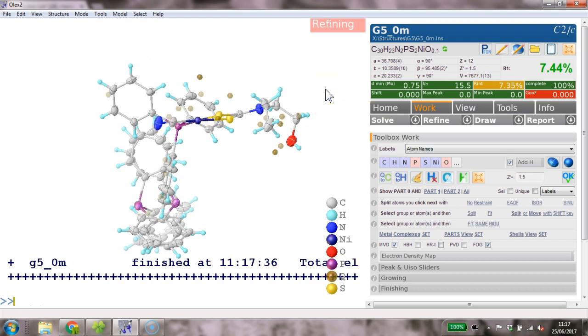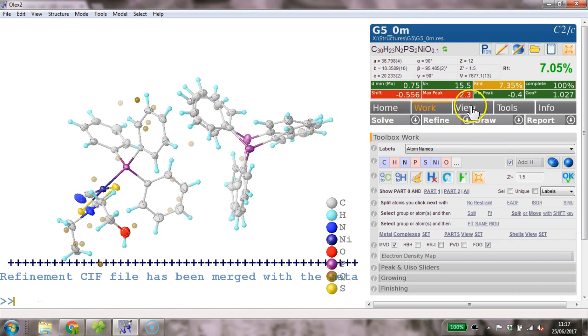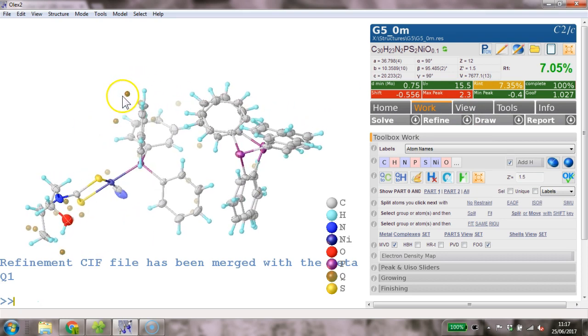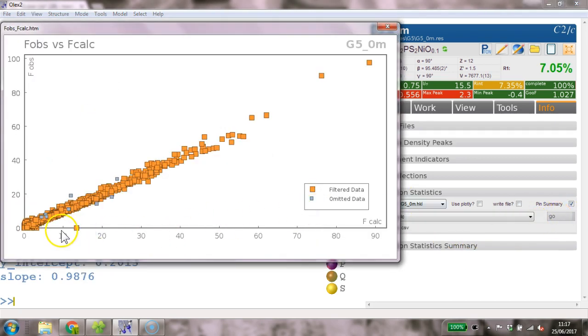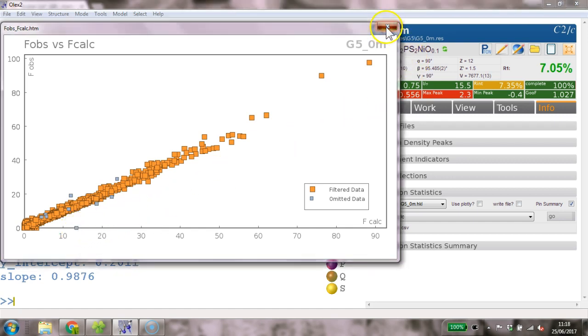Now let's find whether we have some sort of disorder or something going on here. Well, first of all, the biggest peak, 2.3, is actually at that phenyl group here. So that's very strange. That doesn't make much sense. So the first thing I would do, if I look for signs of twinning, is INFO, reflection statistics, and Fobs, Fcalc. Well, there's really no signs of twinning. There's a big outlier that's just omitted here. There's not really any signs of twinning.